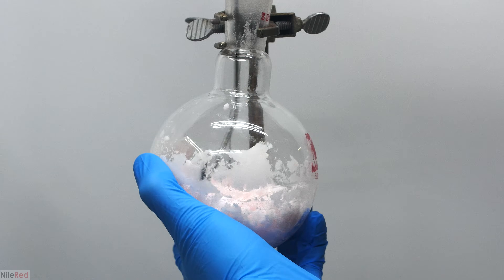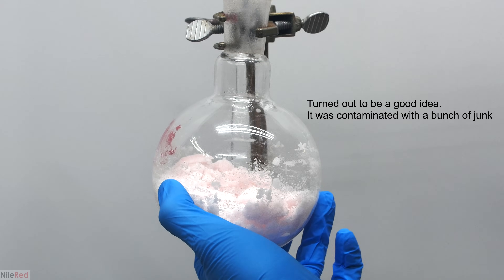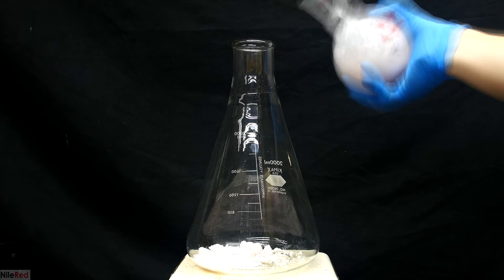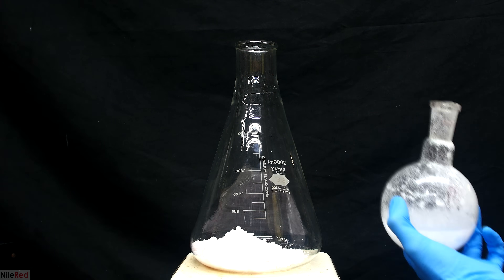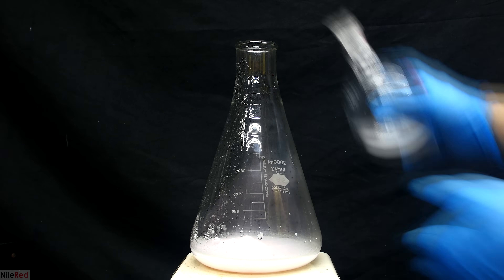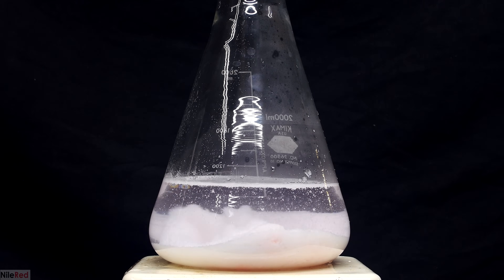Once I've loosened up most of the ASA it's time to transfer it out of the round-bottom flask. If purity isn't a huge concern it can simply be dried and put into storage, but it was still a little bit pink so I decided to do a recrystallization. Transferring it to my 2-liter Erlenmeyer flask was a little annoying since residual acetone caused the ASA to keep clumping up, but after some shaking I got the majority into the flask. The round bottom was then washed with distilled water a few times, and I topped the total volume off to about 1 liter before turning on stirring and heat.